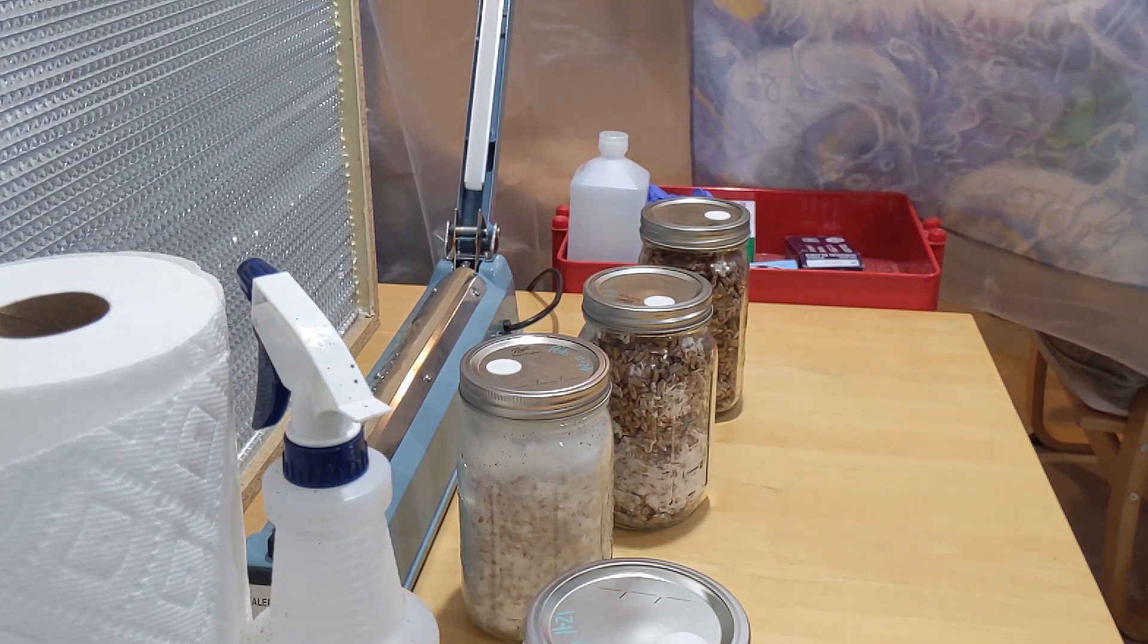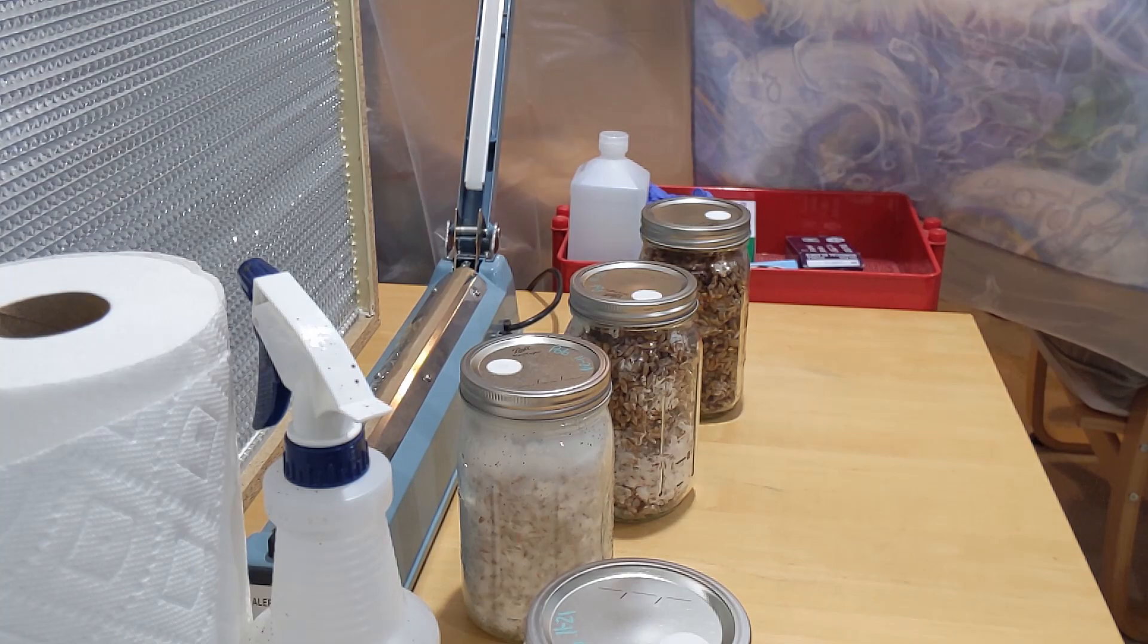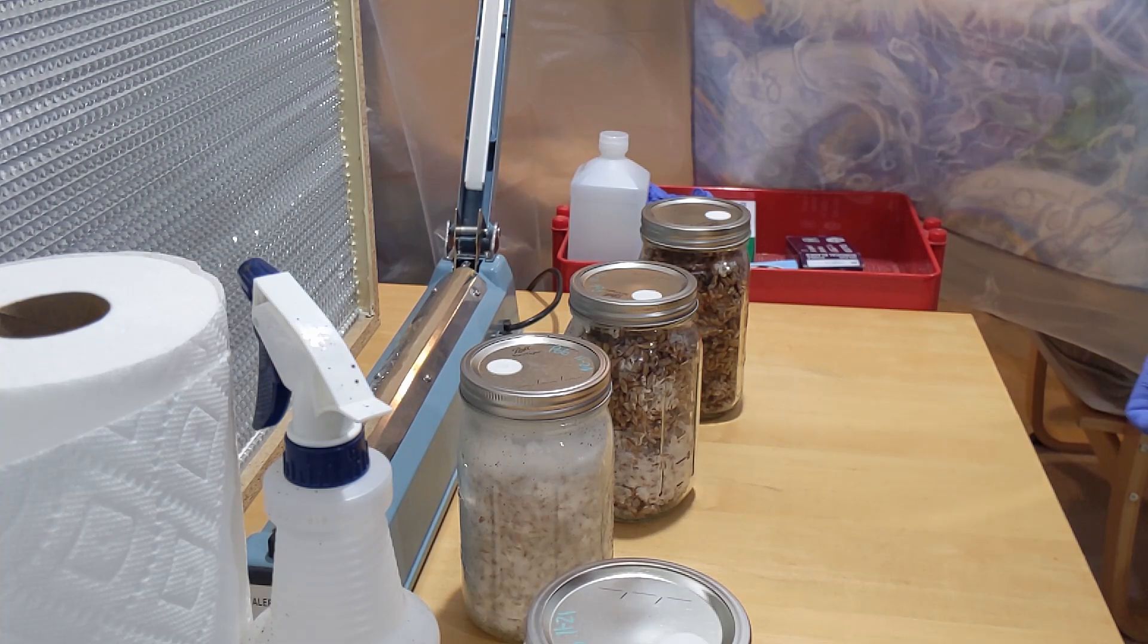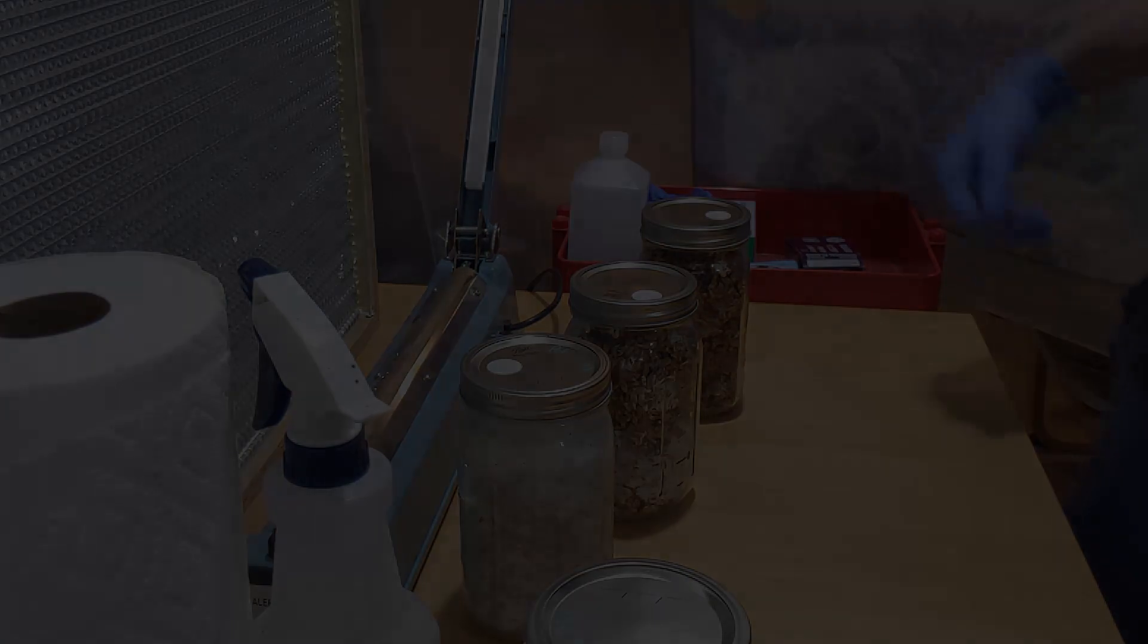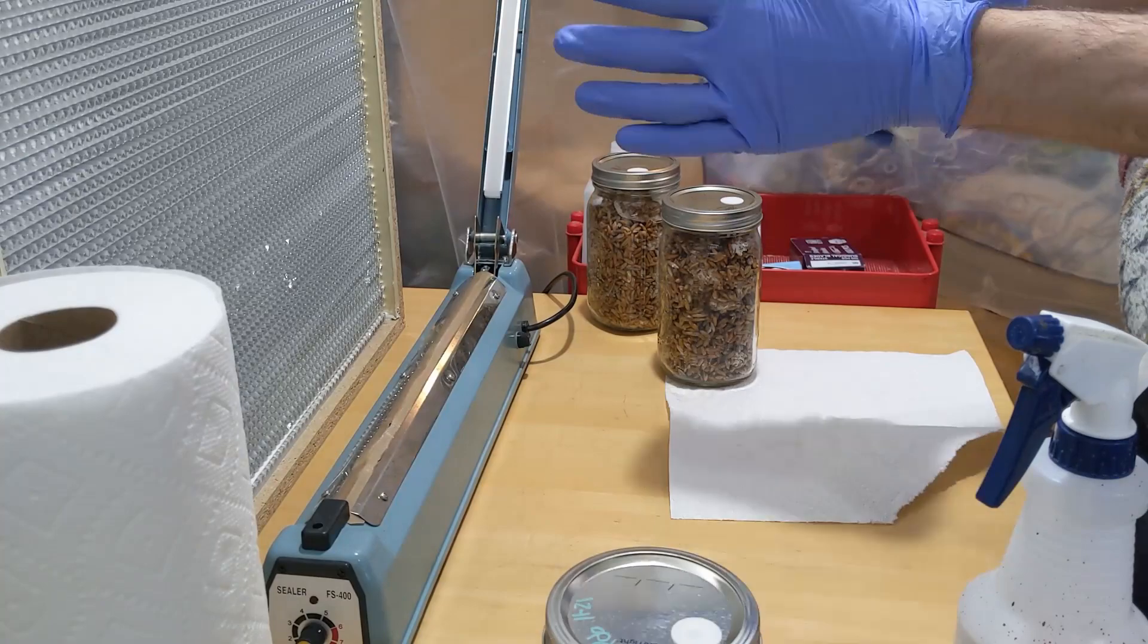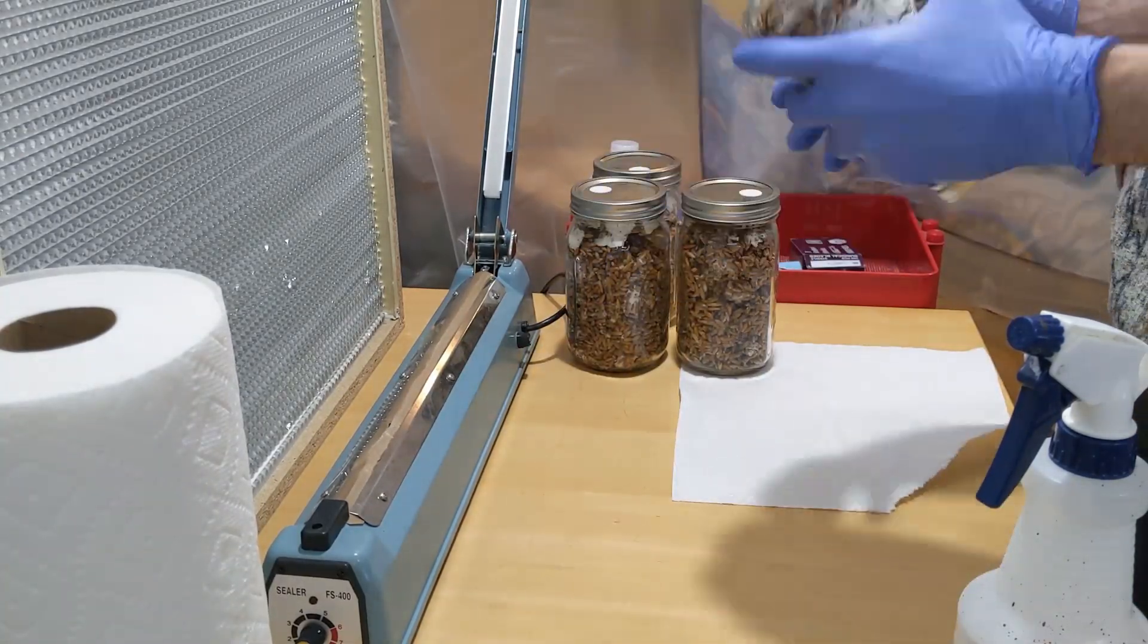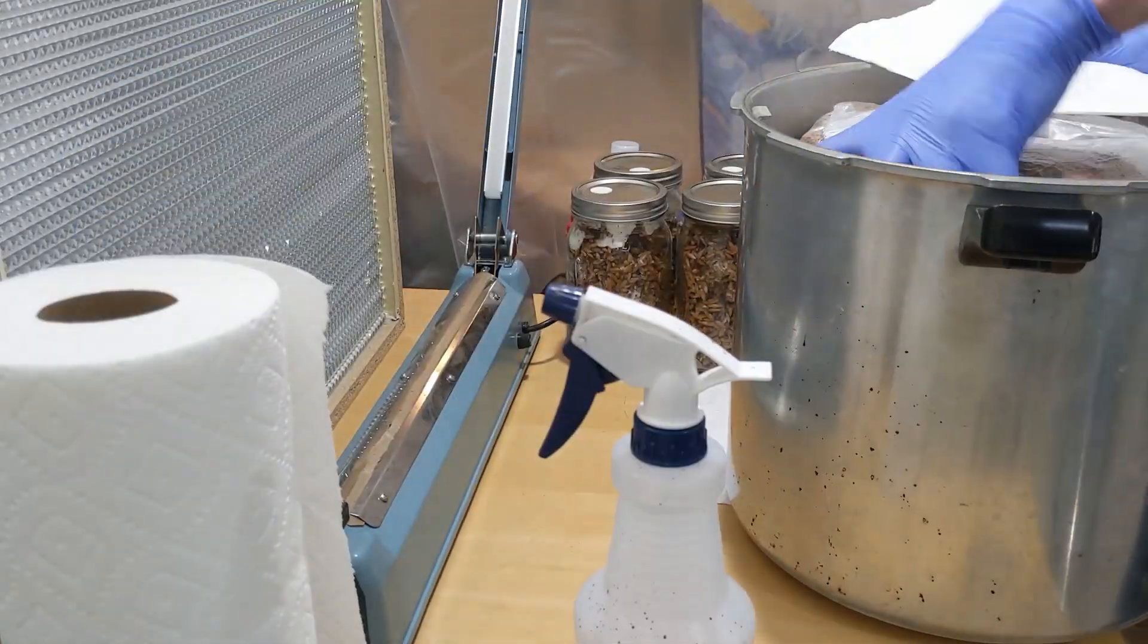It's in my pressure cooker right now. We're gonna grab that, we're gonna turn the flow hood on, and I'm gonna do a time lapse so you guys don't hear that. I'm just gonna go ahead and finish shaking those jars up, making sure they're all dispersed. It's gonna be much easier for me to dump in the bags.